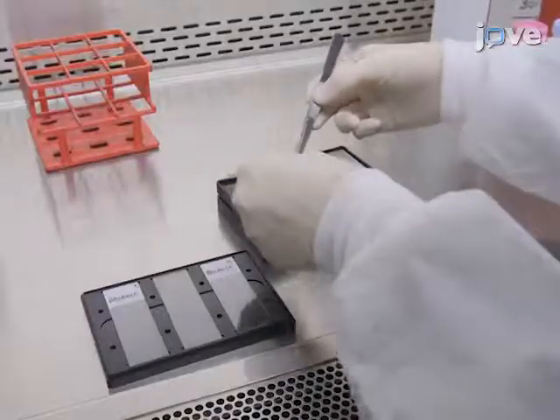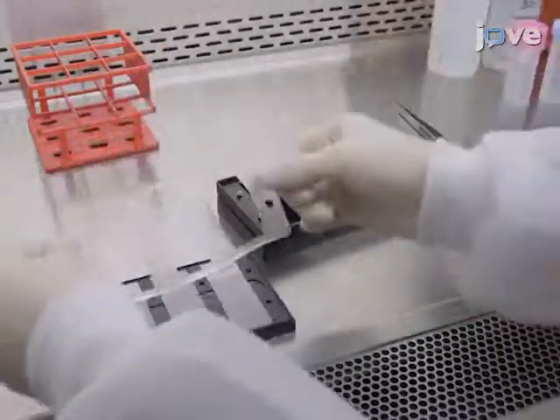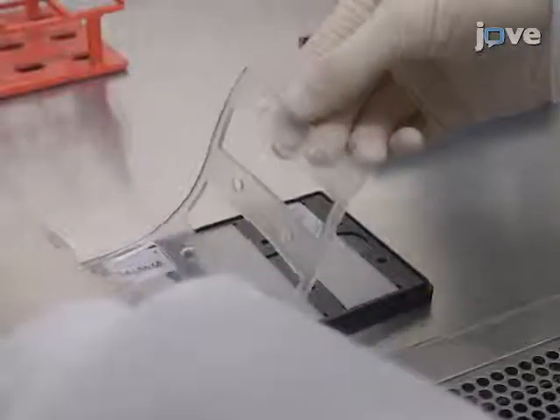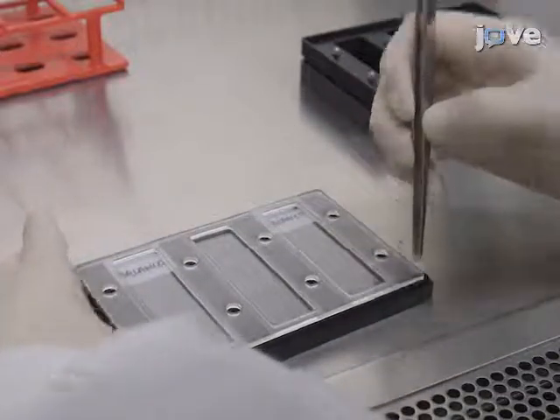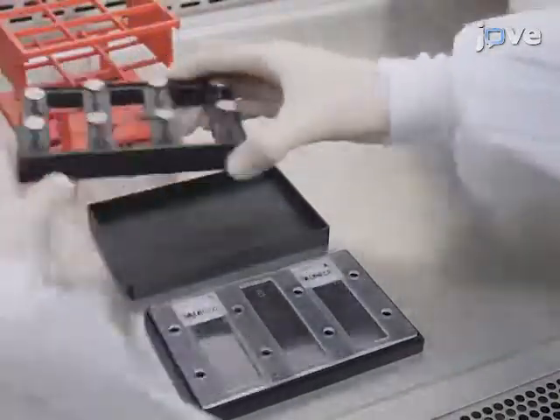Place the glossy side of the seal facing downwards onto the microarray printed surface. To ensure a good position, overlap the screw holes of the seal and the base plate. Place the upper part of the tray onto the seal to create a microarray chamber.